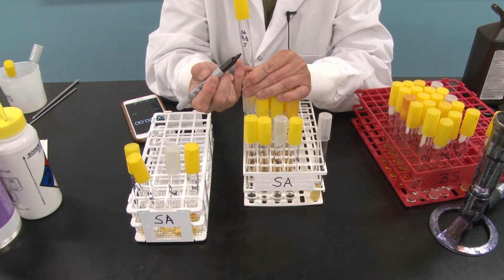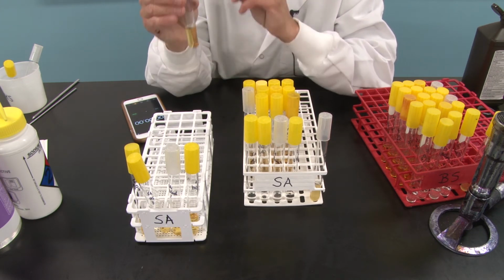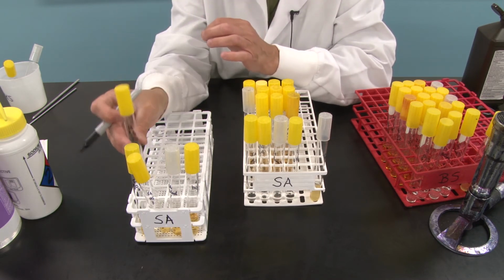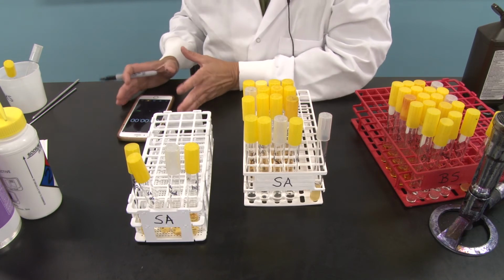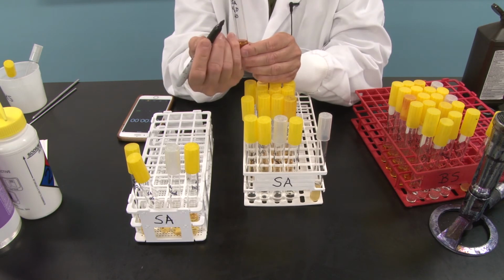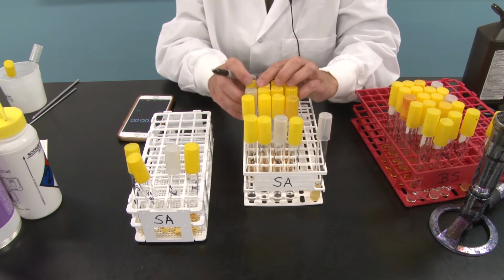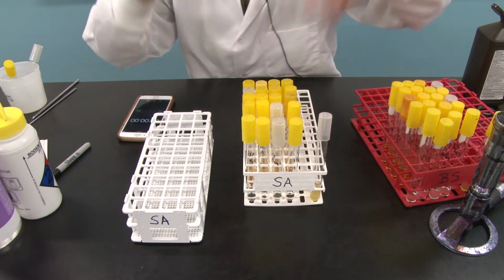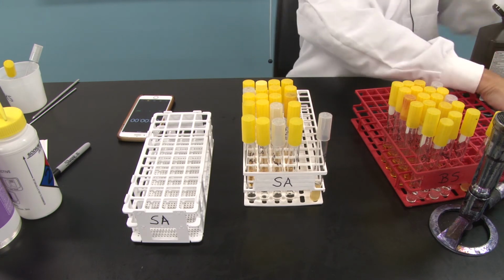SA H2O2 5, meaning this tube represents the bacteria that were exposed to the disinfectant or antiseptic for 5 minutes. It's now in nutrient broth, no longer exposed to the disinfectant. I'm going to move it over here. When we're all done, we will put these in the incubator. I'm going to keep my stopwatch going. When 10 minutes is up, I'm going to do the same thing into these tubes that are marked SA H2O2 10 and so forth. And when 15 minutes is up, in the back tubes. So let's get started. And I'm going to go ahead and start up my fire. I've got my goggles on.